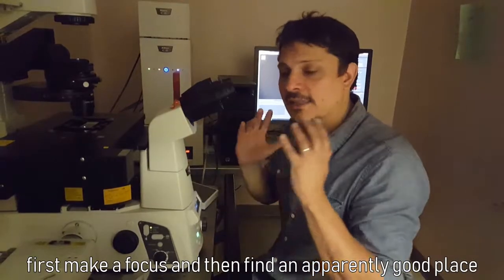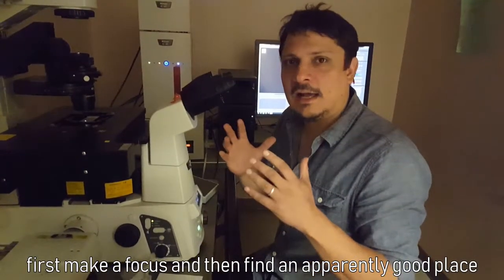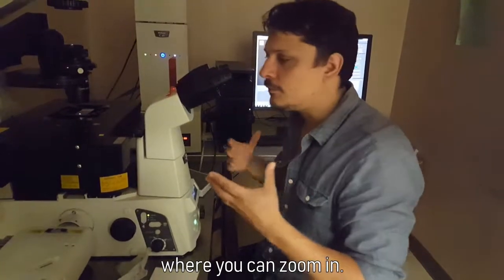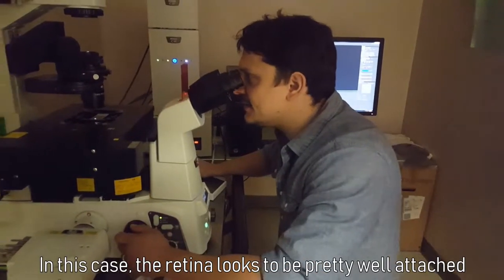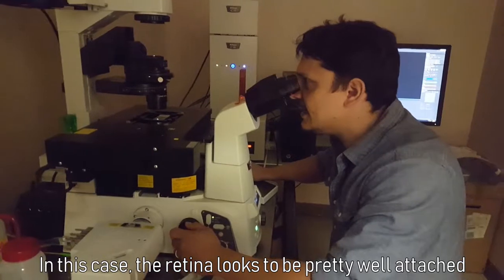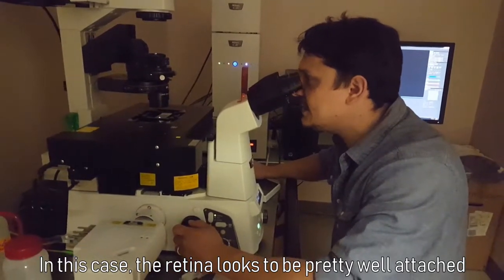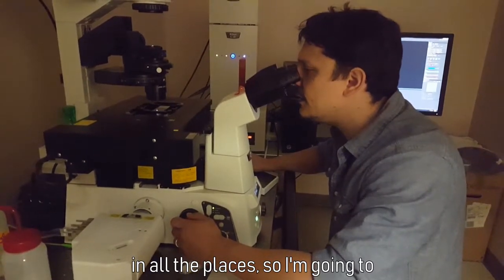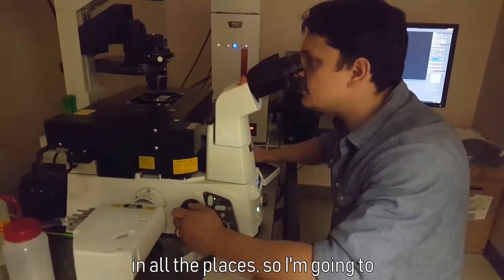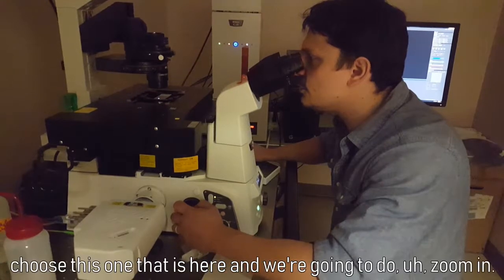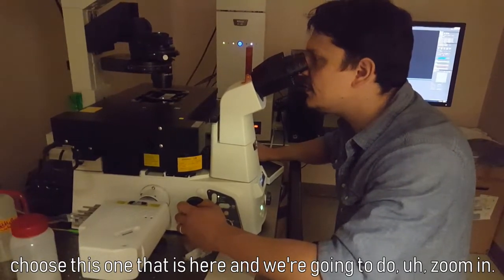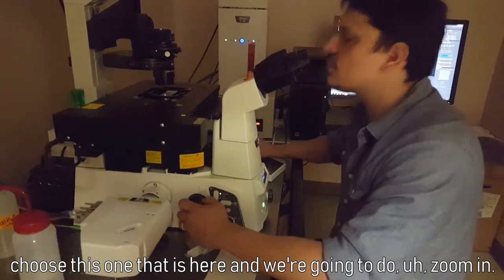And then to find, apparently, a good place where you can zoom in. In this case, the retina looks to be pretty well attached in all the places. So I'm going to choose this one that is here, and I'm going to do a zoom in.